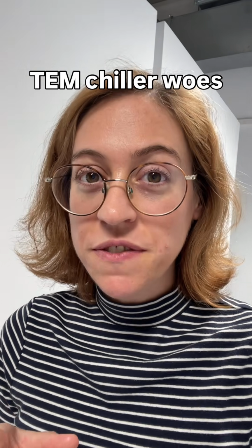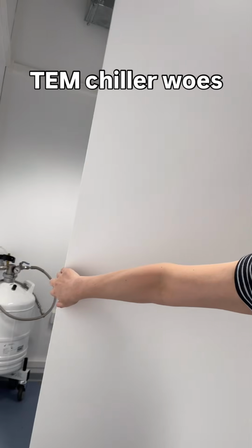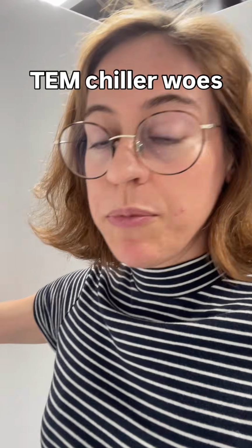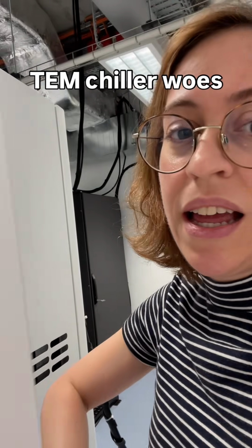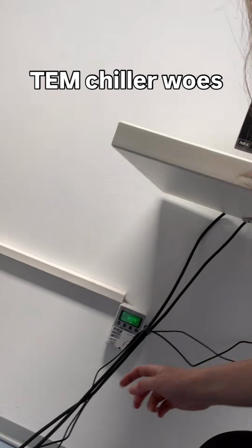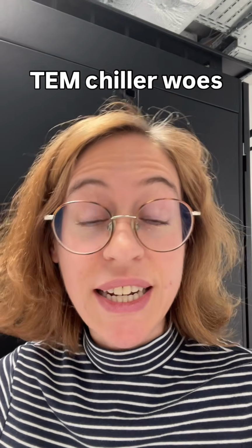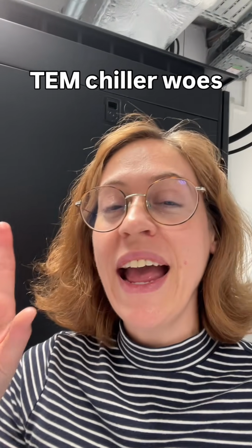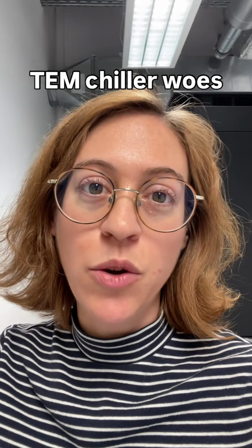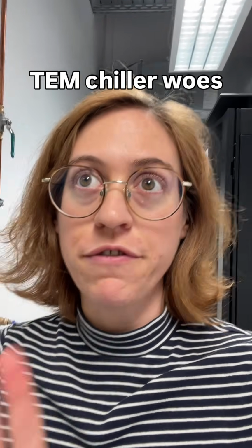The not so fine thing is when I was filling up the liquid nitrogen before the session, which we use this unit for, the dewar is in the microscope. There was an alarm that went off, and that was related to this unit down here. She's tucked back here. That's an oxygen detection system, and it meant the oxygen levels in the room were getting dangerously low, so I quickly left the room and watched the unit that we have in the hallway to see when the oxygen levels had recovered. Then I came back in and didn't continue filling the liquid nitrogen because there was enough for what we needed it for.